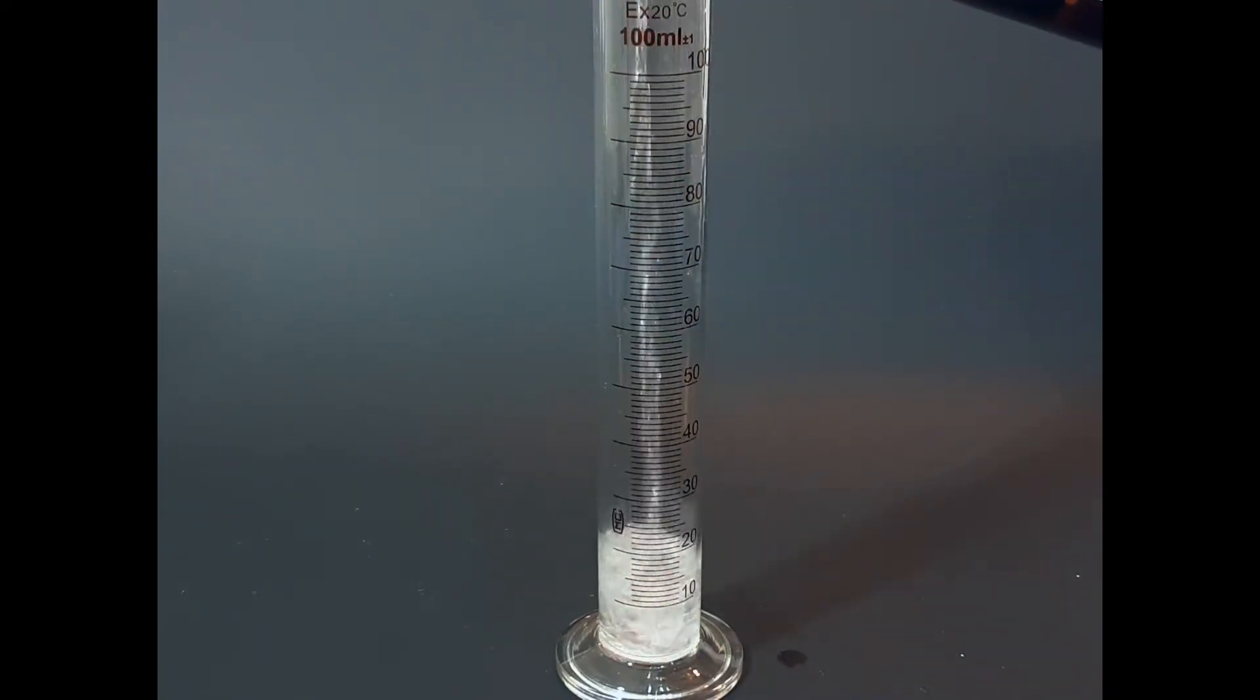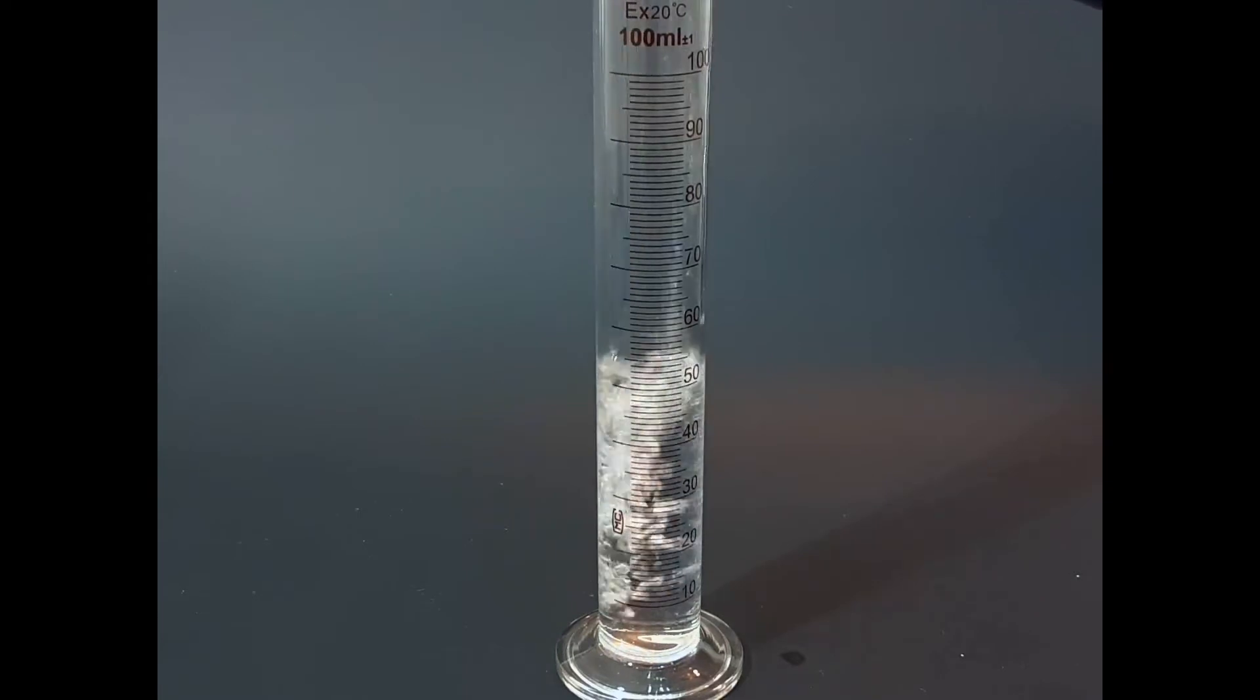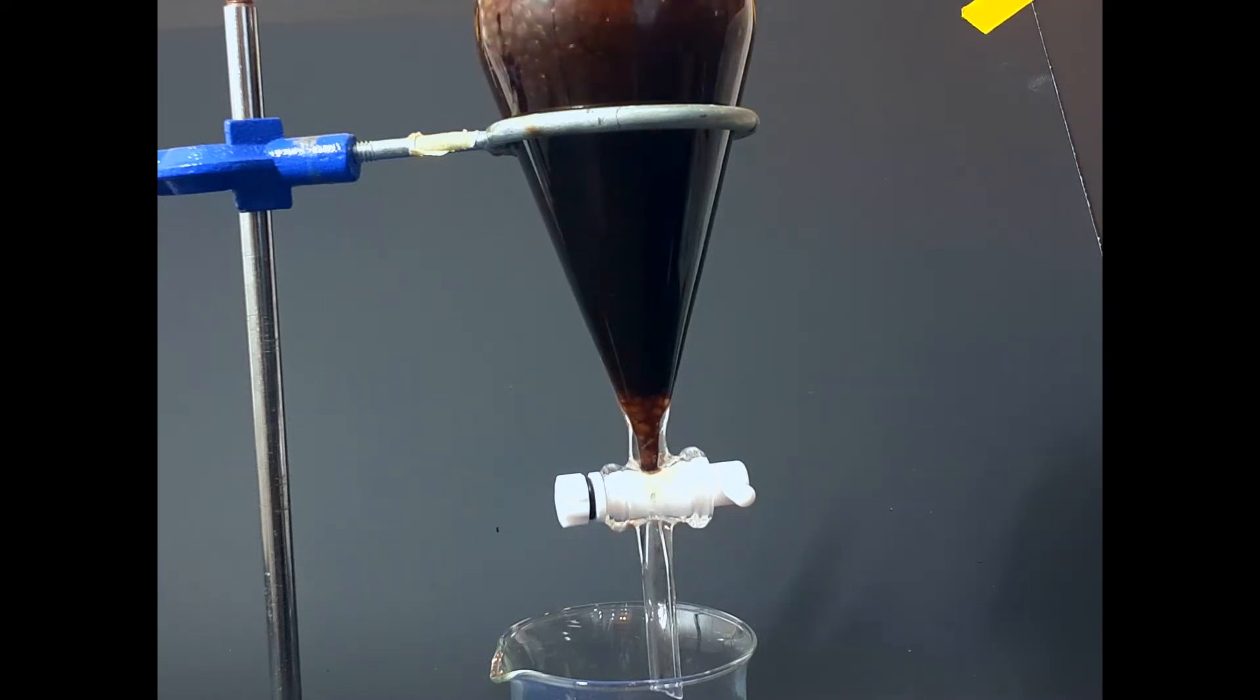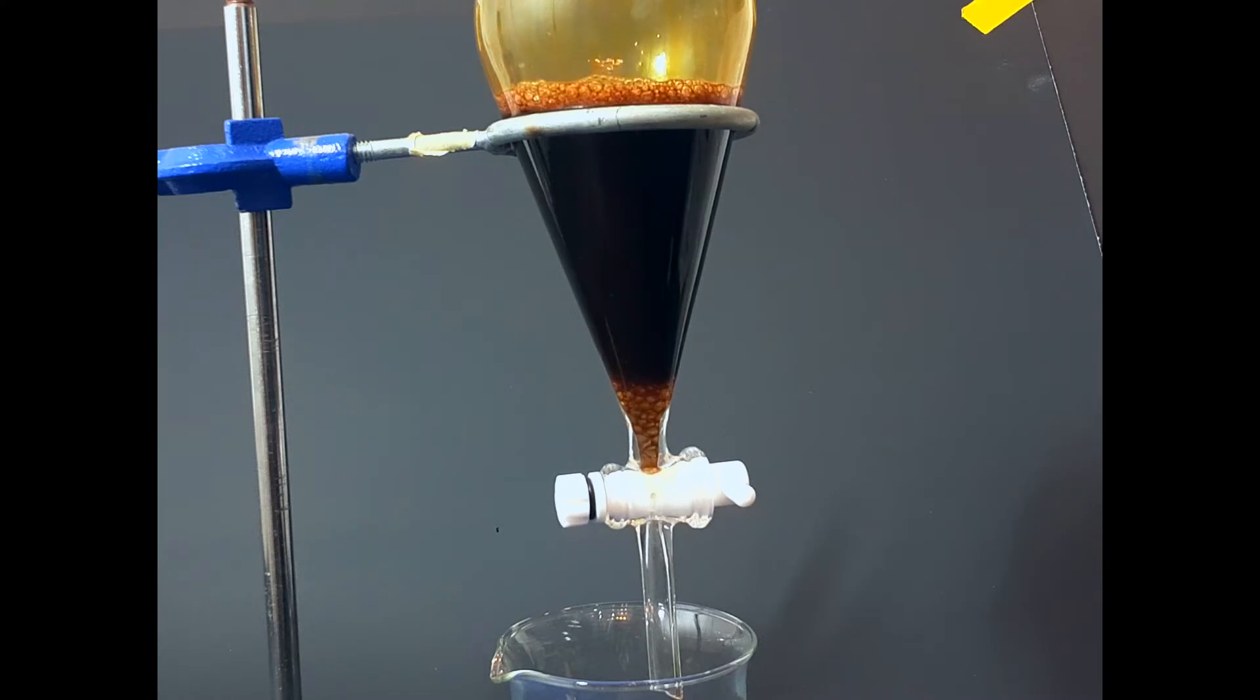It is recommended using a beaker, but I was kind of dumb and I used a cylinder instead. You can see some drops fell off because dichloromethane has a high density—it's a very heavy liquid. Now I'm going to add the DCM. As you can see, once again I was very clumsy and did not add it slowly. Don't do this. If you're trying to do this experiment, make sure that you're putting the DCM very slowly because it is very cold, and the difference in temperature is going to react physically with the coffee which is warmer.